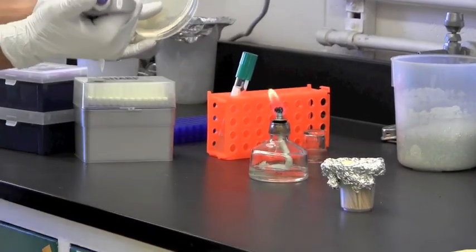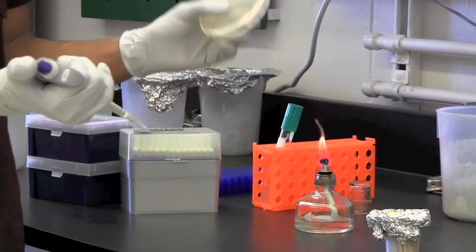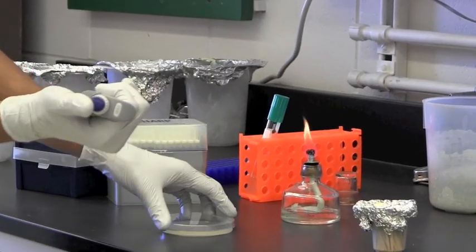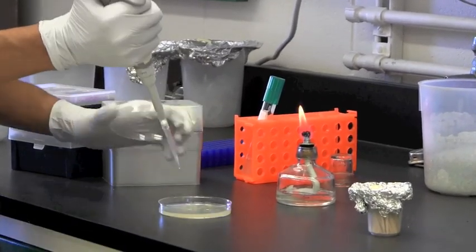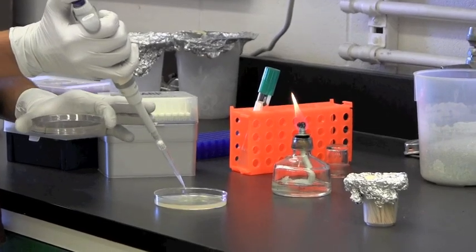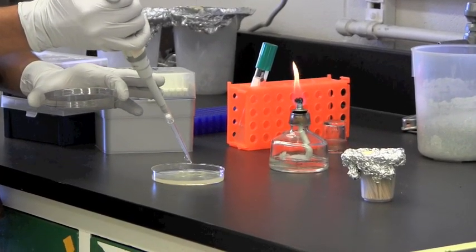Now I have my labeled clean agar plate ready, and I will inoculate it by simply dispensing my sample onto the surface.